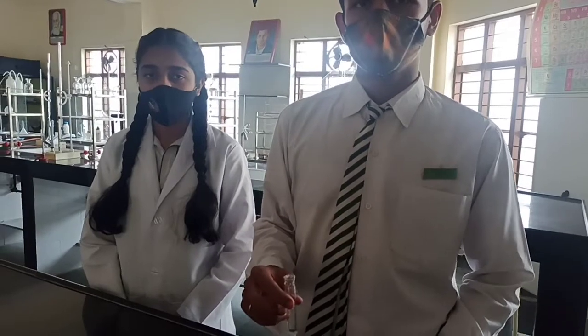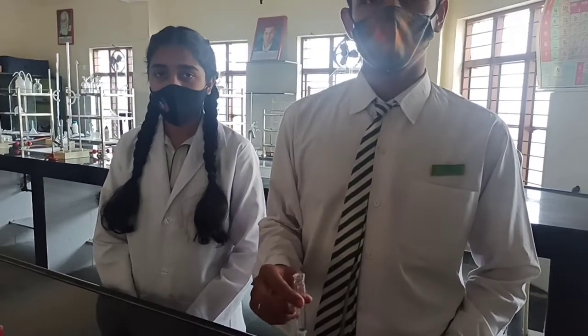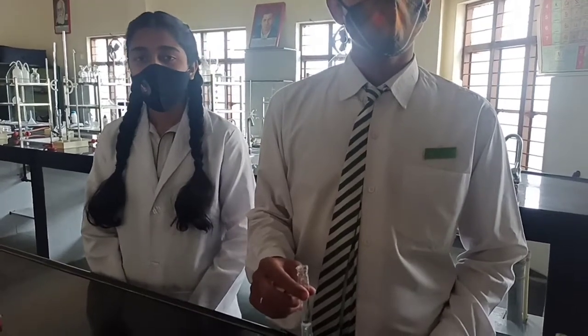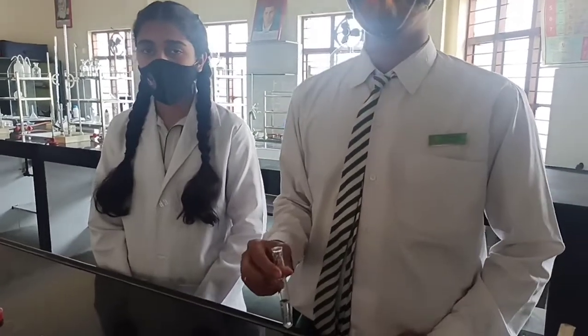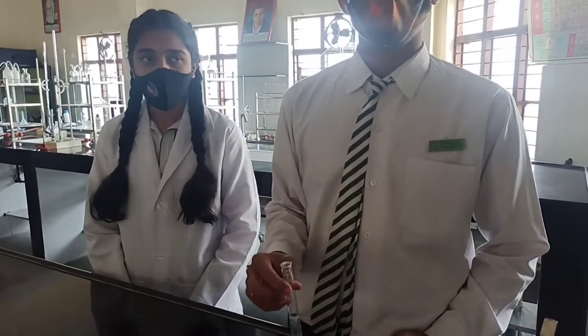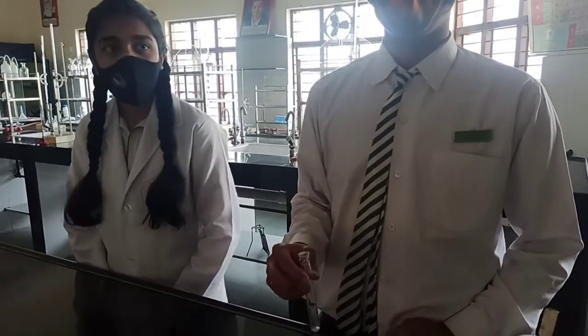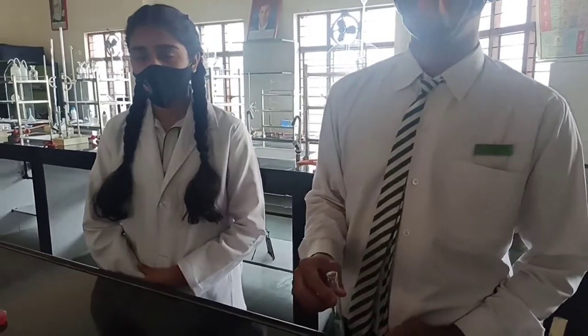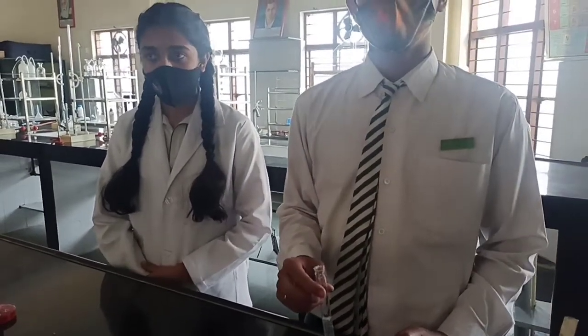Now, what we are going to do? We will be doing the preliminary test. Preliminary test is a rough test. You can also call it a guess test. It will give us some hint of what radicals may be present. Like on smelling we came to know it is an ammoniacal smell. So ammoniacal smell means ammonium ion can be present. But first of all we will have to perform the anion test. So we will not test ammonium because ammonium is a cation.